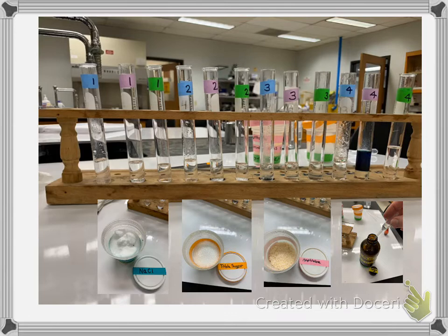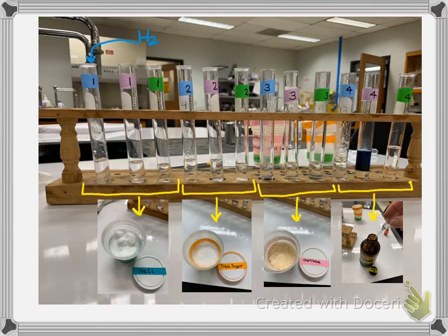Everything with a 1 is sodium chloride. So here's the sodium chloride results. Here are the sugar results. Here is the naphthalene, also just so you can kind of see what they look like. And here is the vegetable oil. For each test tube shown, the first one in the series is water. The second one, the pink label, those are all isopropyl alcohol. And the third one in the series, the green label, those are all ethyl acetate. Sorry.